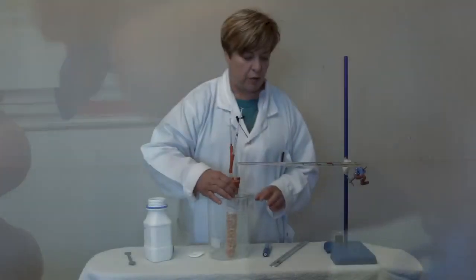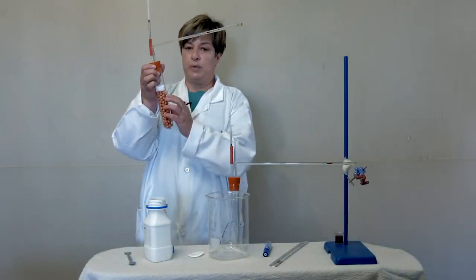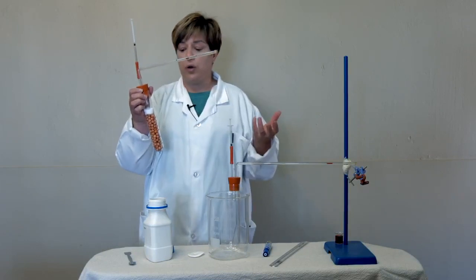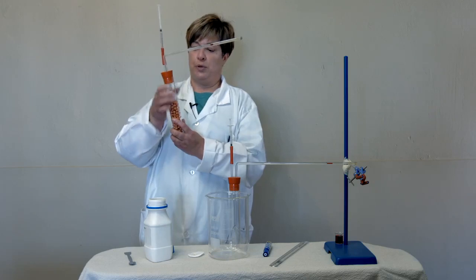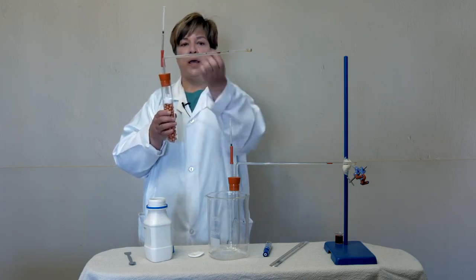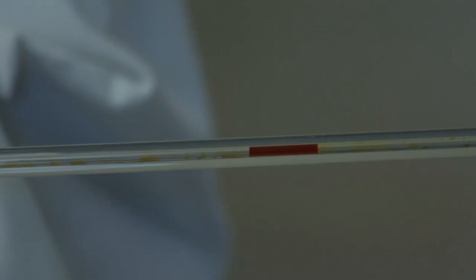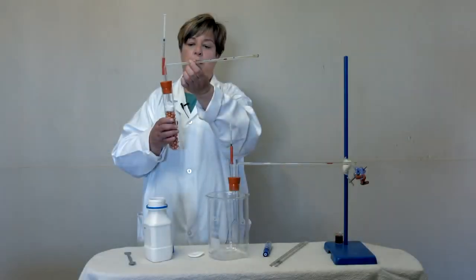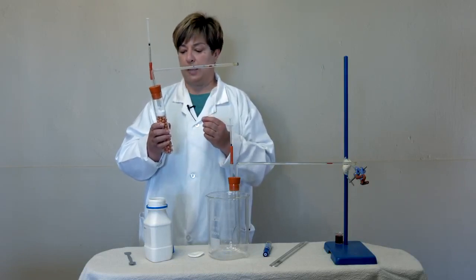If we look at our experiment, we will see the pea seeds are germinating, so they need energy to grow, and they will be using all the air that is in this tube. Eventually, they will start using the air that is in this tube, and they will suck that air bubble, that red bubble, down the tube. And the speed or the rate at which it sucks that bubble down the tube is how much oxygen is being used in a minute.